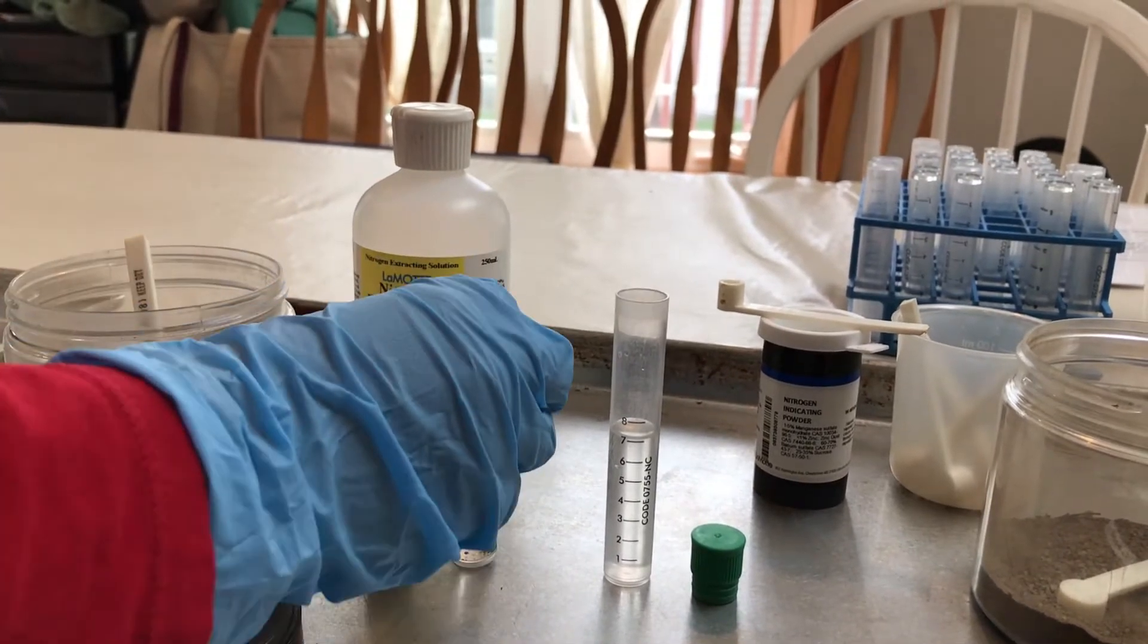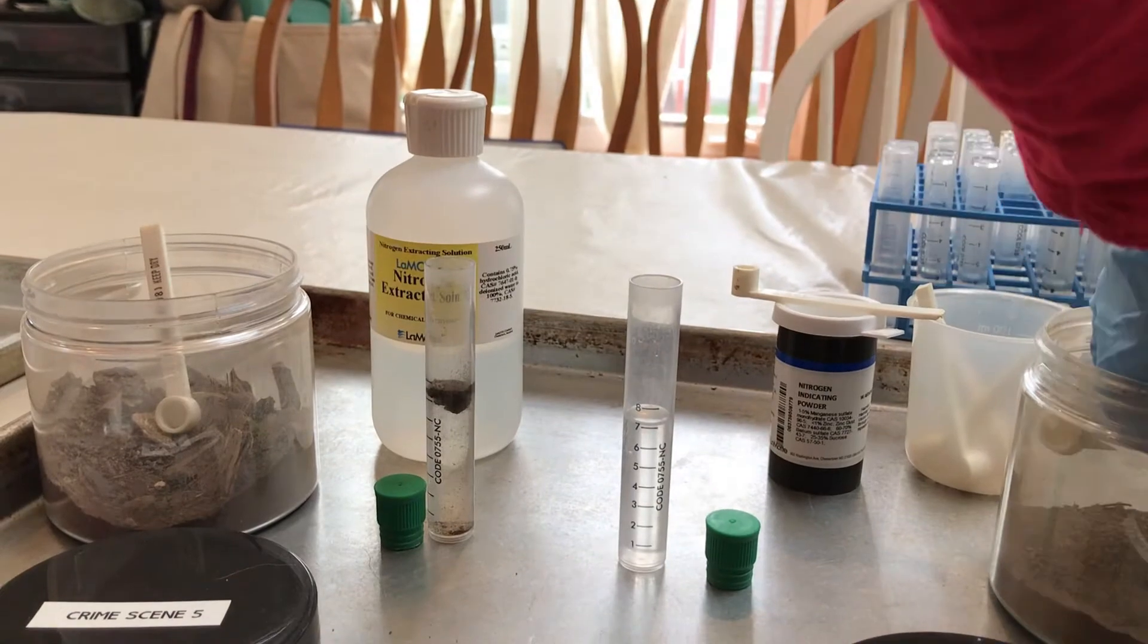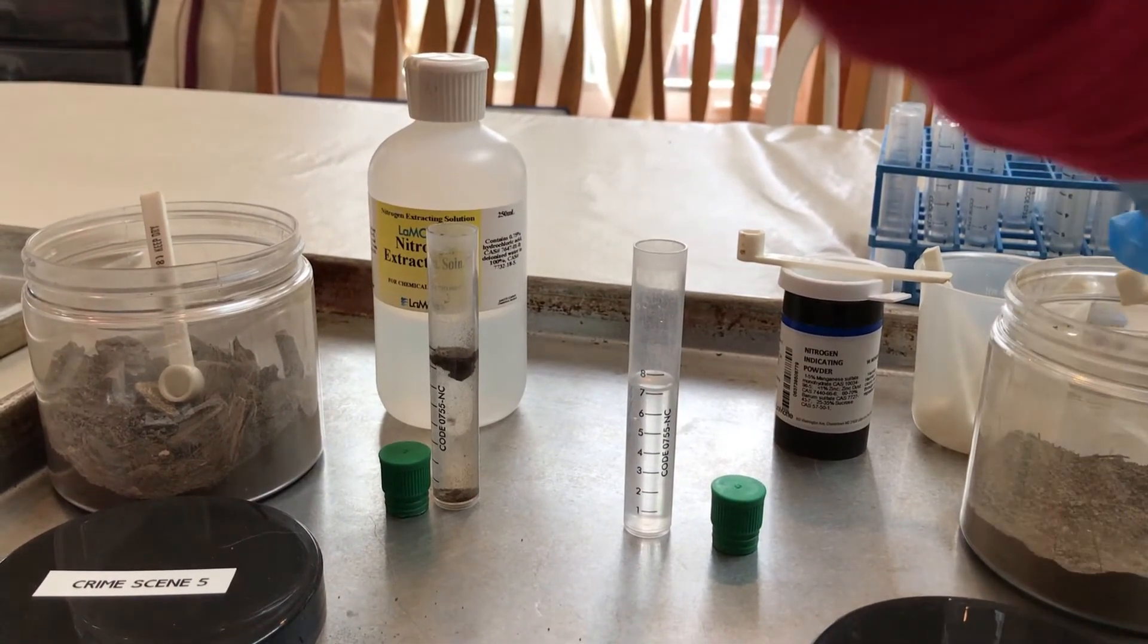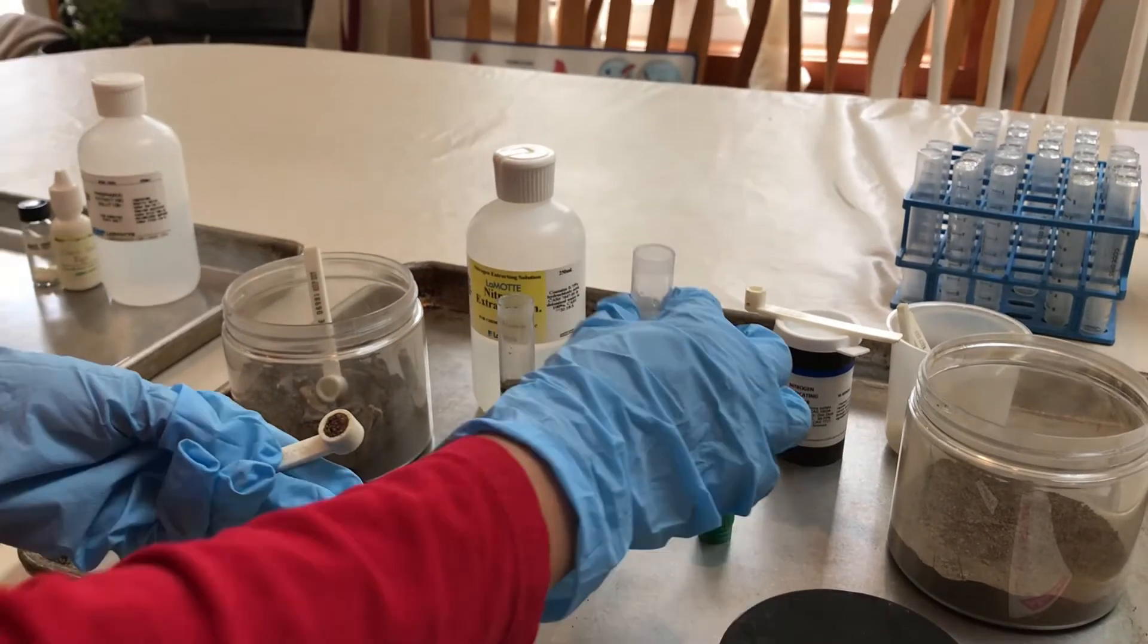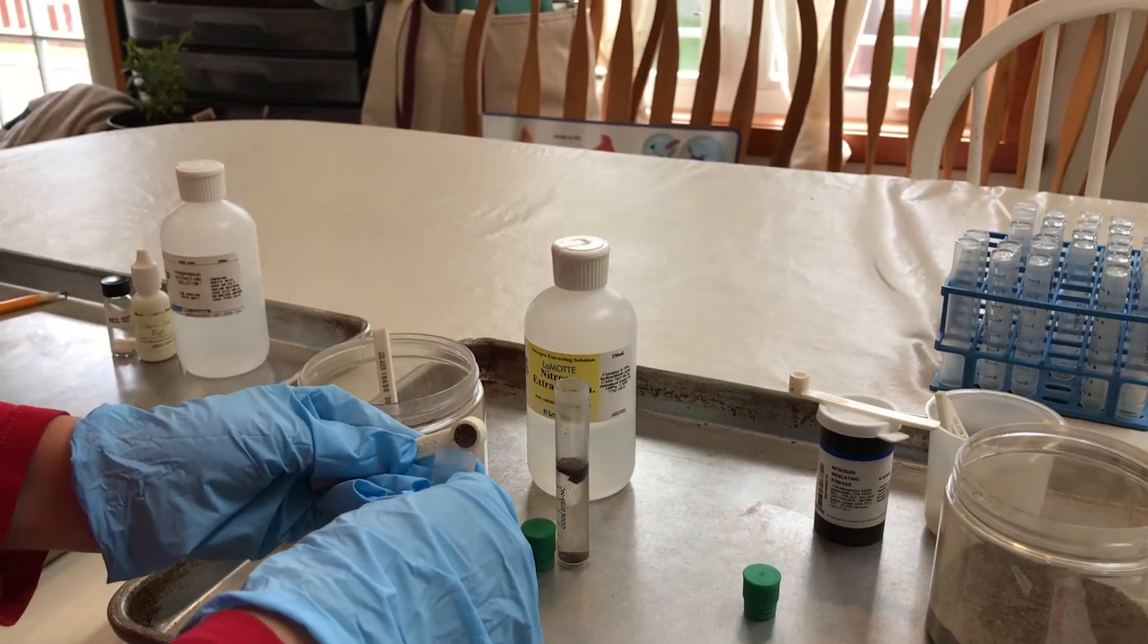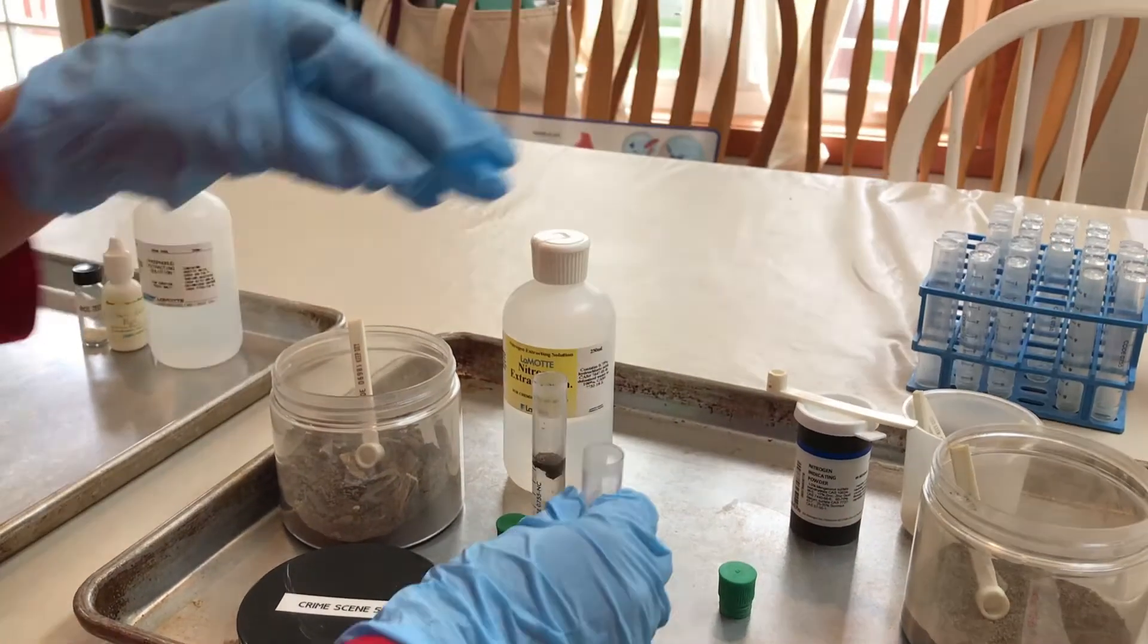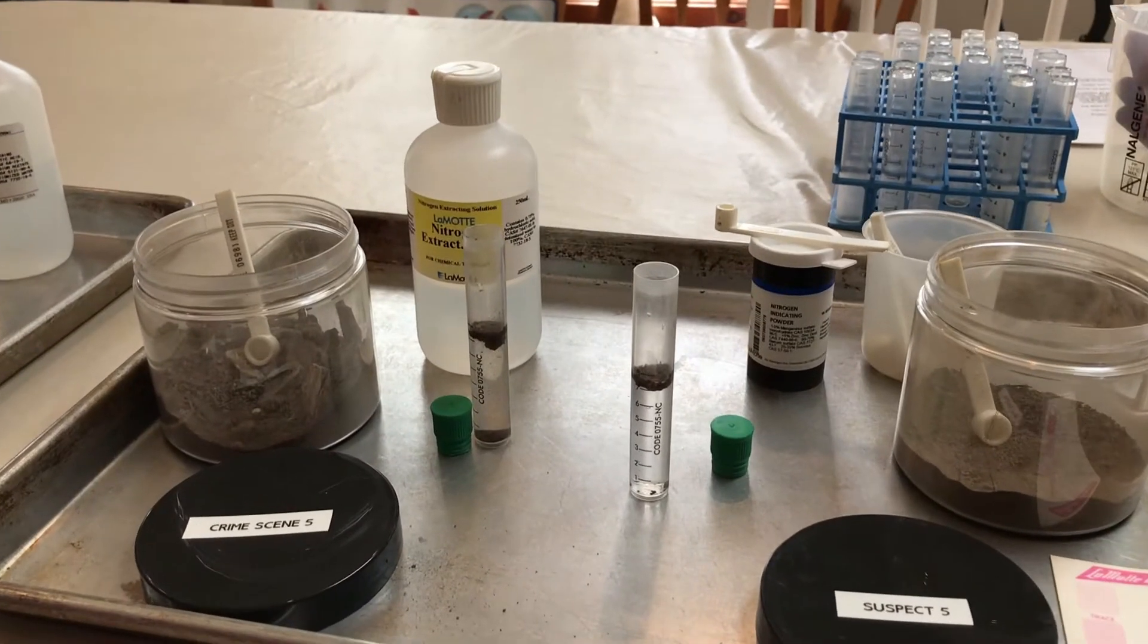Now we're going to add one scoop of the suspect soil sample to the nitrogen extraction solution. Now what the solution will do is actually extract the nitrogen from the soil.